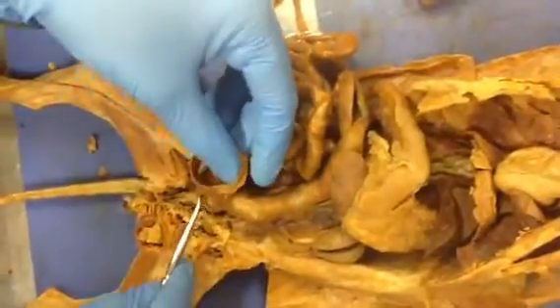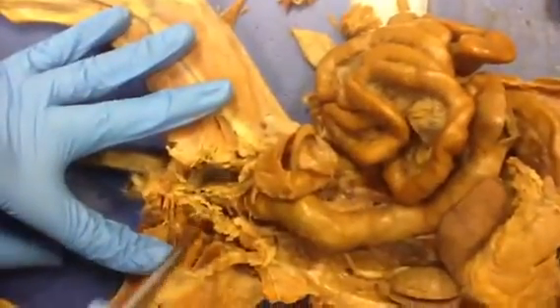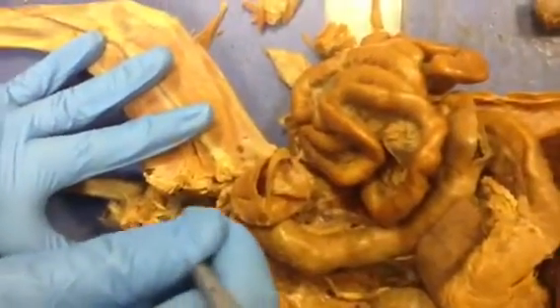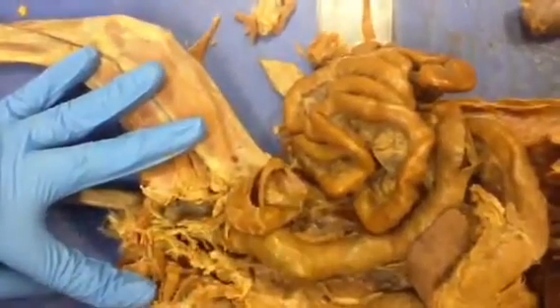Now the urethra goes down, okay? And here the urethra actually got cut, but here was the prostate, this dilatation in this region. So we don't see it properly. And then the urethra exits over here via the urethral orifice.